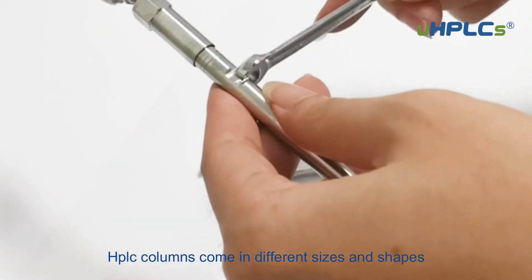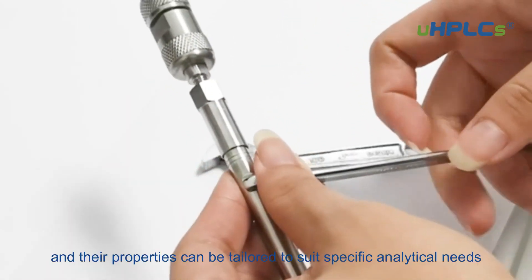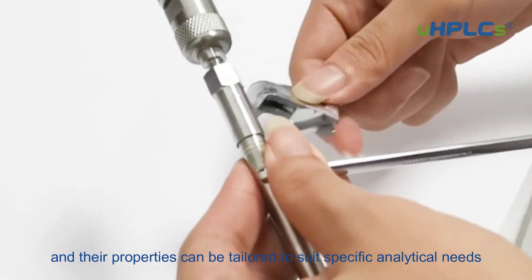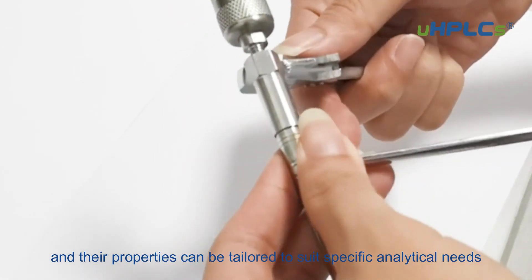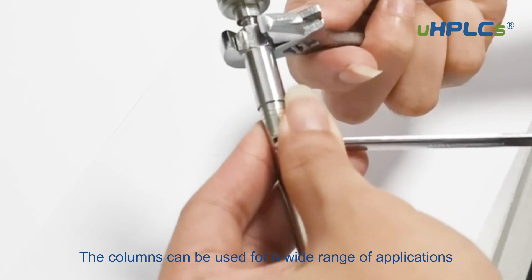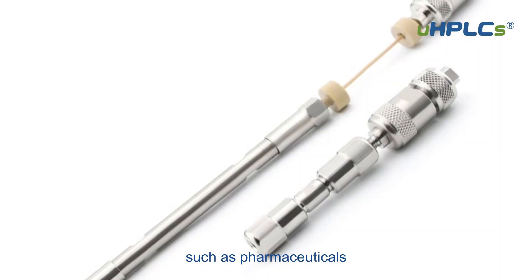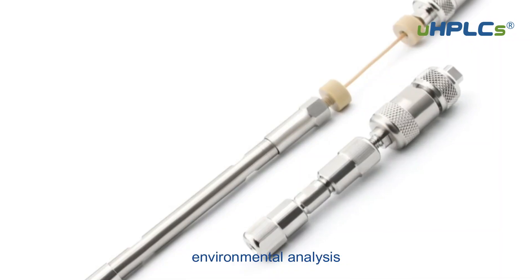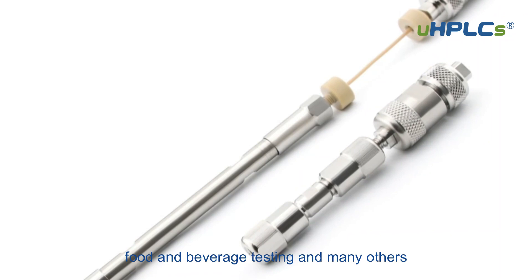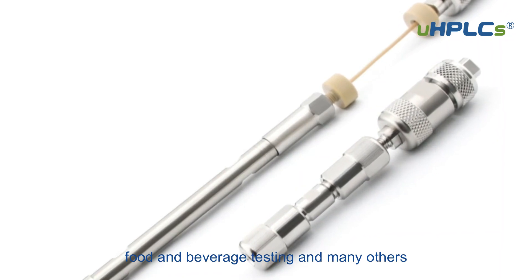HPLC columns come in different sizes and shapes, and their properties can be tailored to suit specific analytical needs. The columns can be used for a wide range of applications, such as pharmaceuticals, environmental analysis, food and beverage testing, and many others.